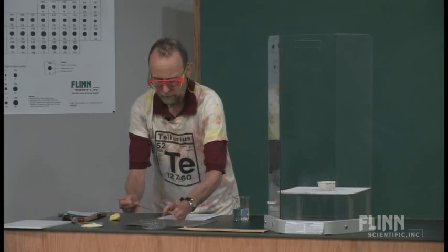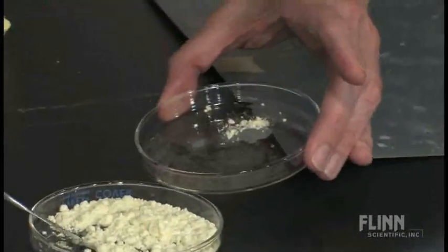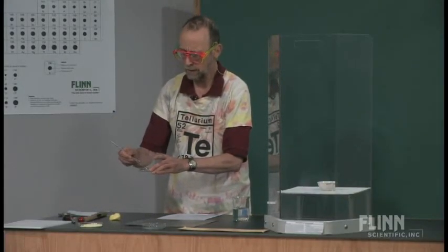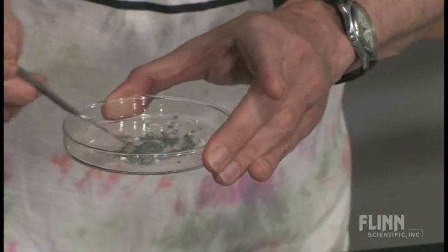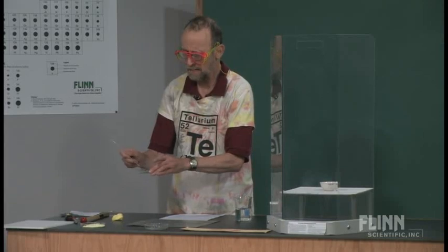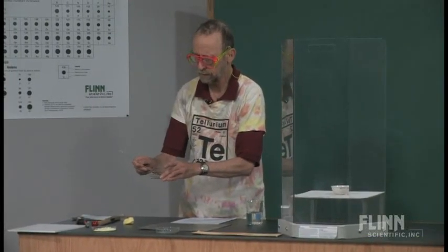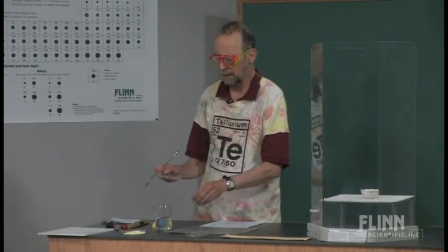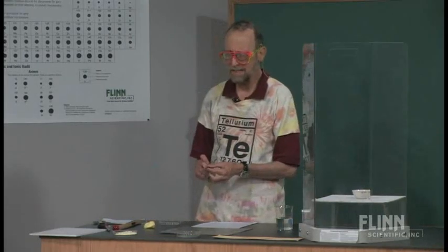We will need to use the powder forms, because we want these to have intimate contact. I'm going to take a scoop of zinc and I'm going to take a scoop of sulfur. And I'm simply going to mix these up. At this point, we're not going to get much of a chemical reaction. These are both solids, they're at room temperature. They really need some activation energy. They need to be heated up in order to react. So, we have a mixture. And it's not even really that homogeneous. I can still see lumps of each present. Eventually, I might be able to get it sort of homogeneous. And I could separate this because it's a mixture, it's easily separated by a physical means. I could pour it in water. In this case, because it's flour of sulfur, the sulfur, a lot of it would float. The zinc would settle to the bottom. And you could separate the two. But once we form the compound, zinc sulfide, then it won't be easily separated by physical means.